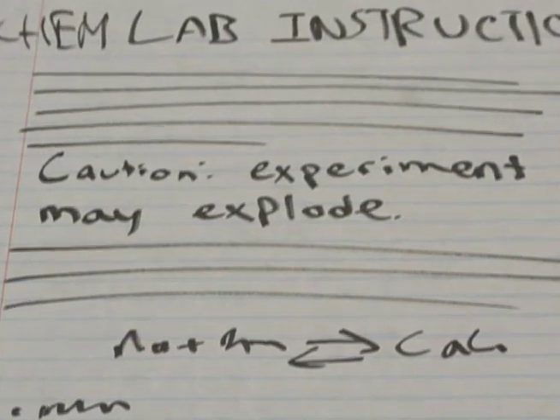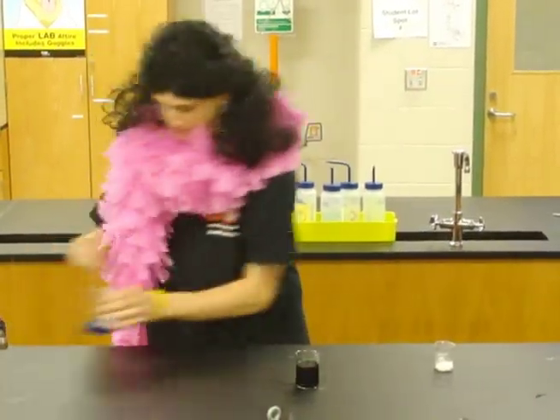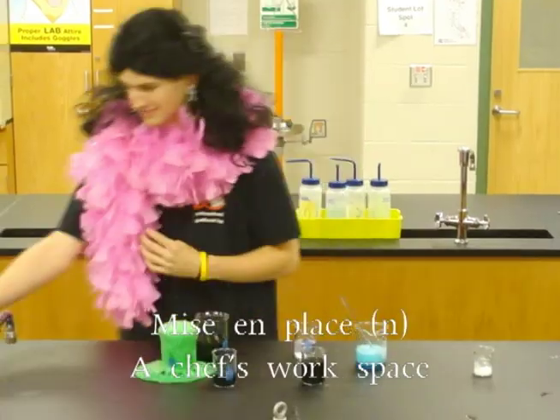Read the procedure so you know what's coming. Unexpected results can send everyone running. Don't eat snacks or chew gum, or you'll fail and end up a bum. Clean up spills immediately, or things could end unfortunately. Always maintain your mise en place, or you may find yourself kicked up a notch.